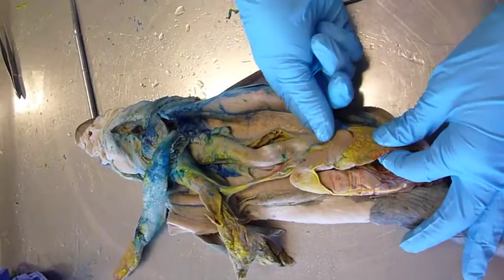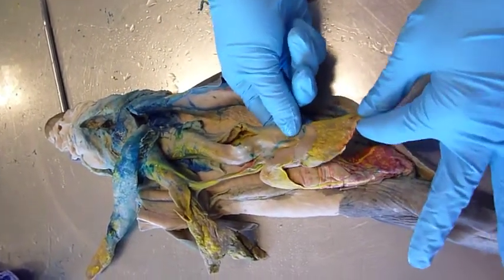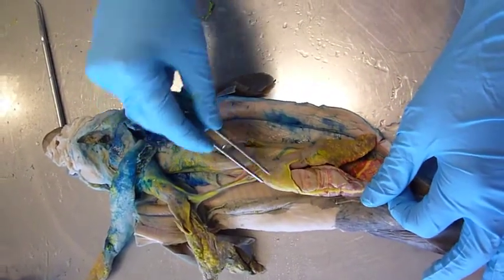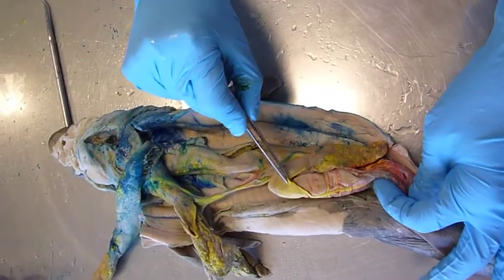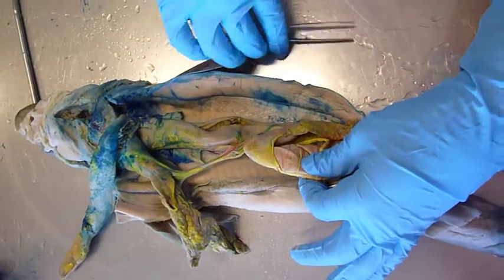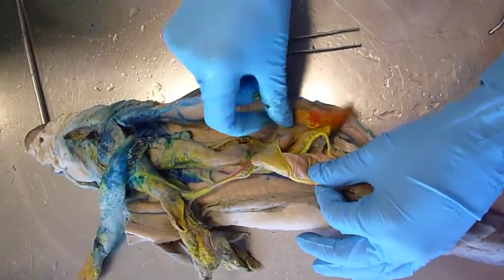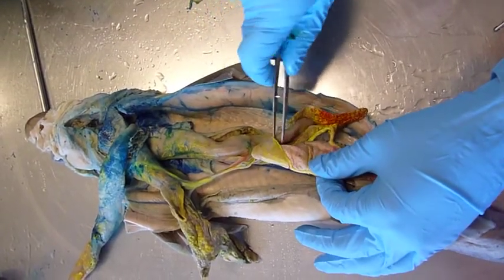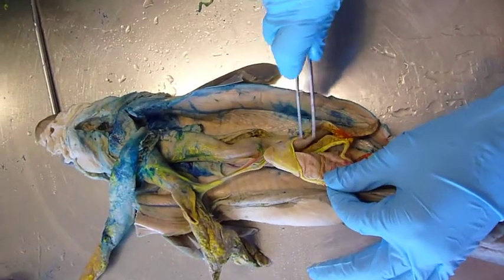Attached to the stomach is the spleen, this organ right here. Also attached to the stomach right here is the ventral part of the pancreas. There's also a dorsal part of the pancreas which you can find by looking under here. Those two parts of the pancreas are connected by the isthmus.